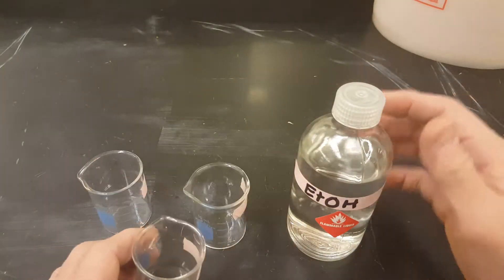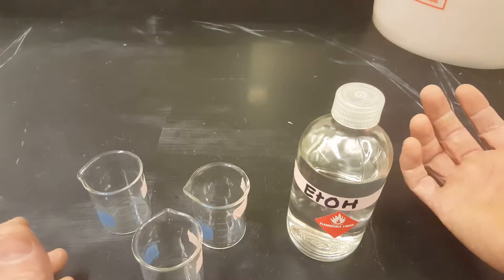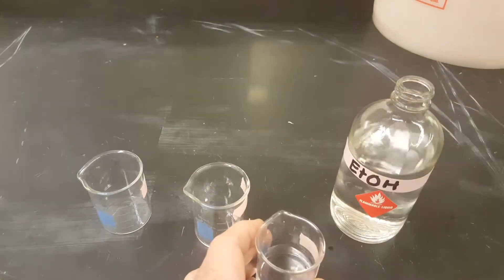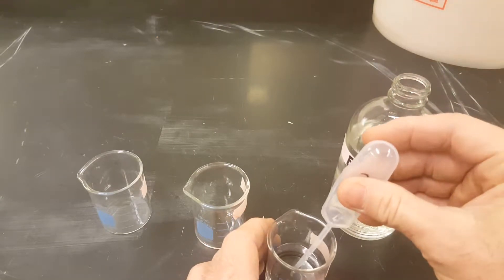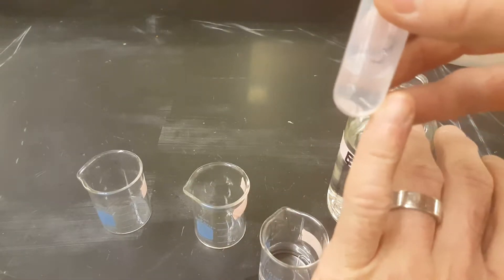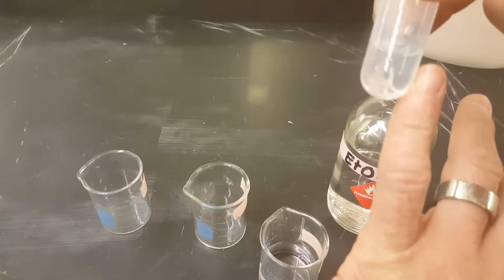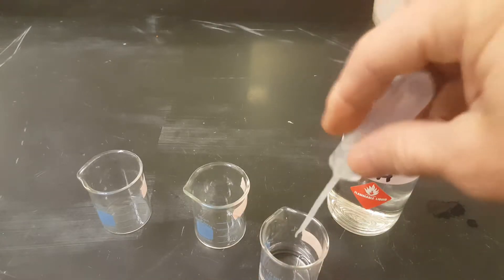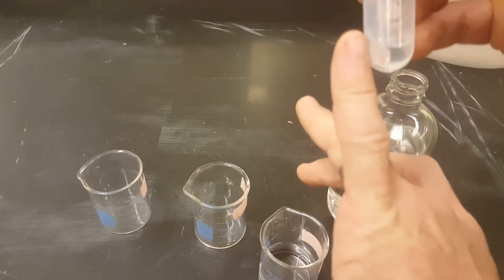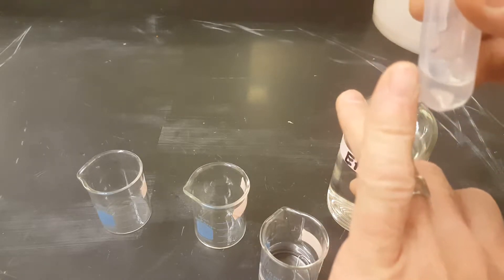If not, empty everything back into the bottle, put the cap back on so that it doesn't get left to evaporate into the room. As you come up, take the top off. Pour a little bit into your beaker and you want to fill your pipette just enough so that you get about a pinky fingernail's height at the bottom. I know that's really rough, but that's how we're going to measure two to three milliliters. And if you get a little bit too much, you can squirt that back into the source bottle until you feel like you have about the height of your lunula here, where your cuticle is, to the end of your pinky. And that's good enough for today.